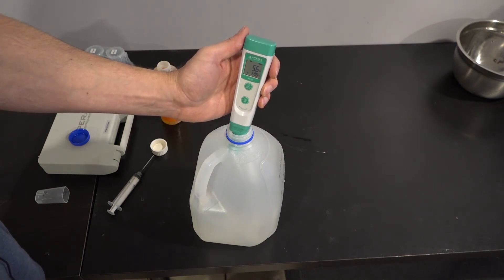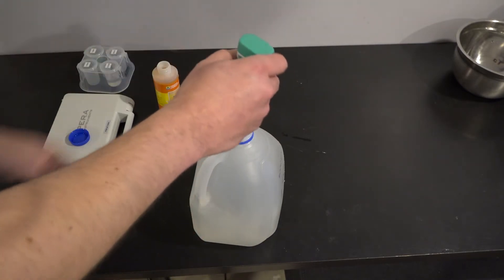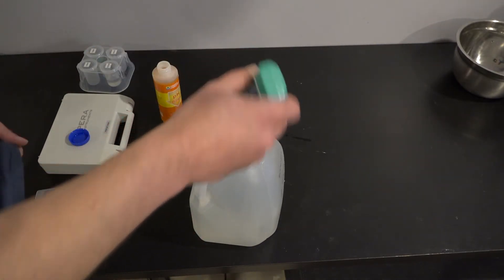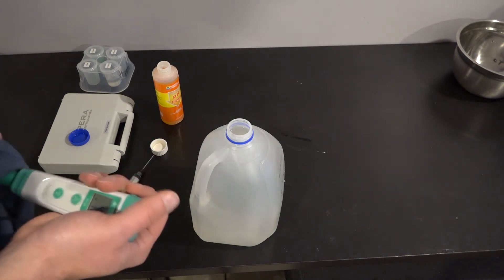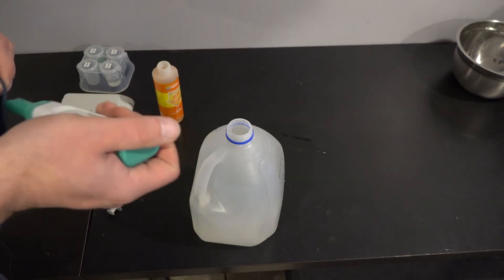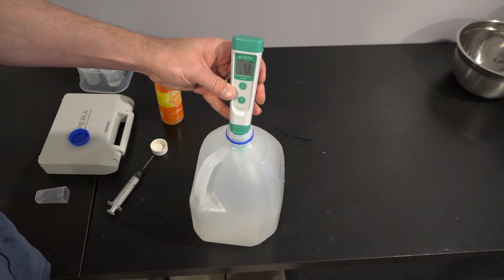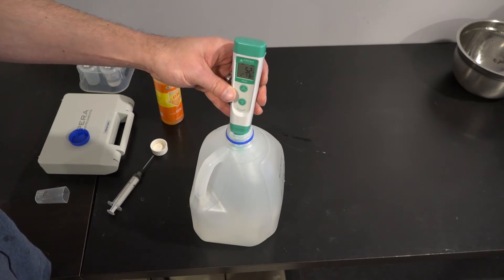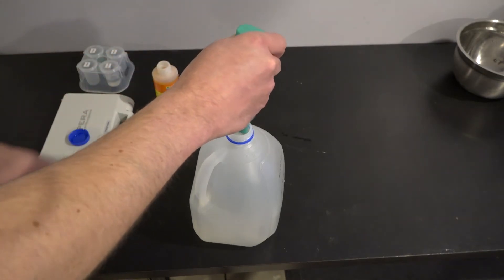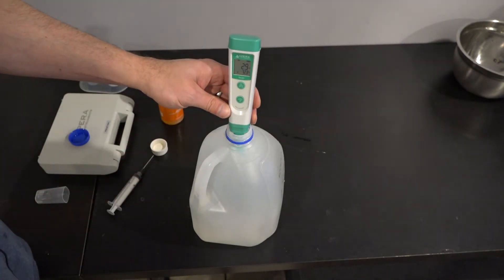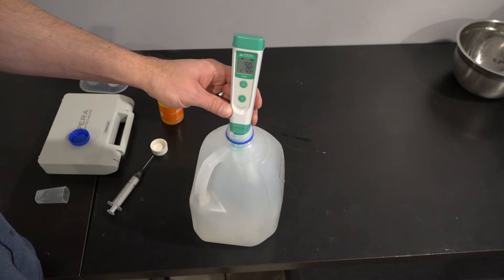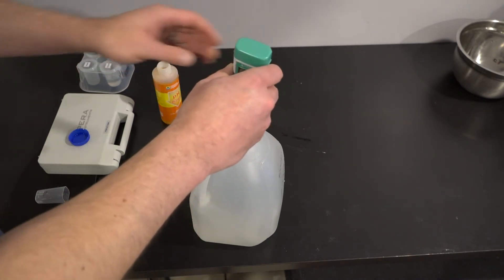Look at that. 5.6, 5.5, 5.4, 5.3, 5.4. So, I went a little far, but I'm going to double check that. Dry the probe off. And, we'll go again. It wants to fluctuate, so that's why I'm a little... So, 5.2, that's a little low.